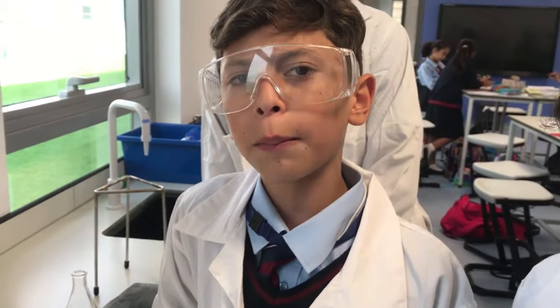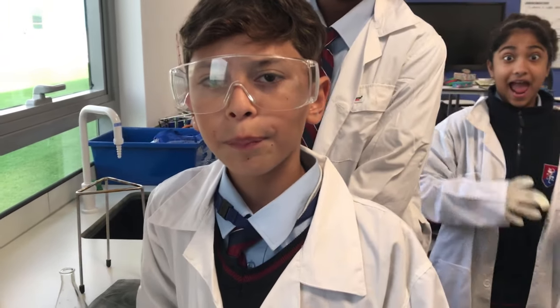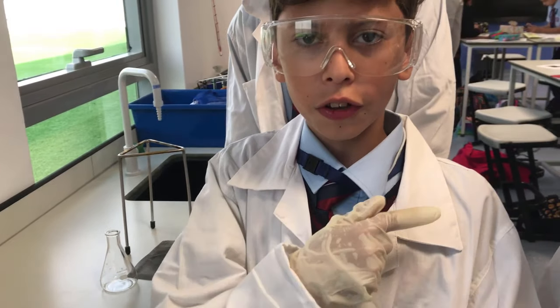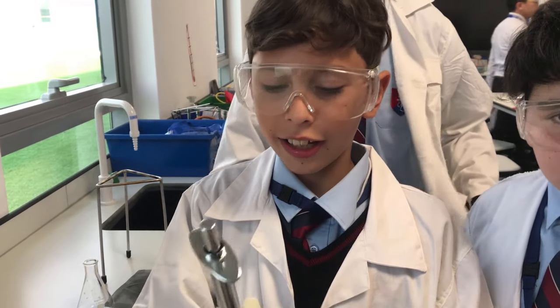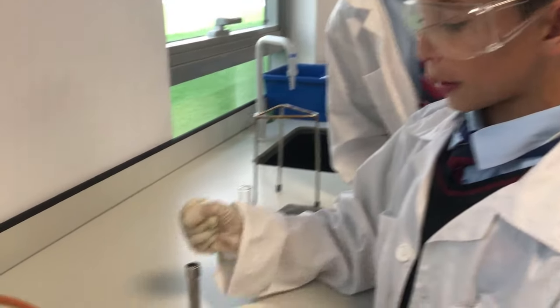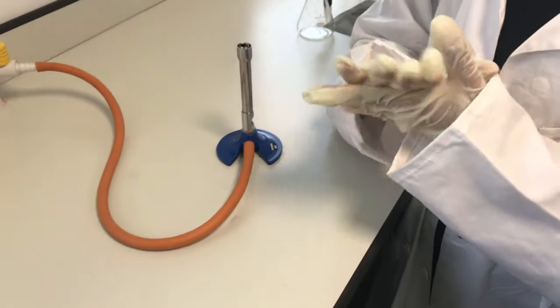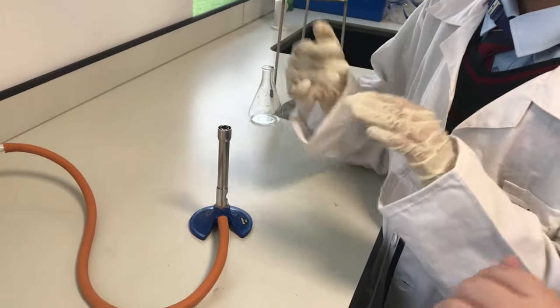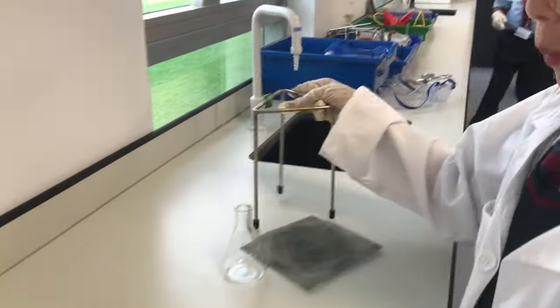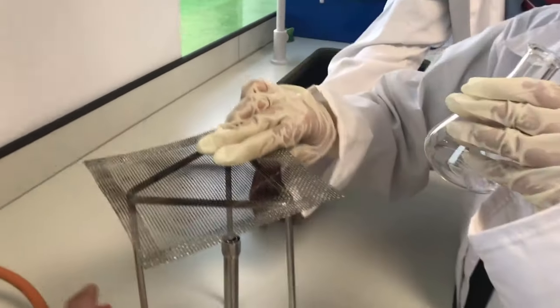That's the only way. Oh yeah, and actually we'll be giving this to other people because we're done using it. Yeah, so we'll give that to them. And guys, this is how you use a Bunsen burner. If there's anything else you want us to... Oh, there's one thing we should do. Here's how to use that.